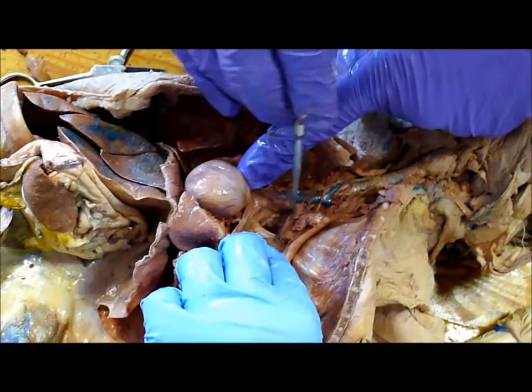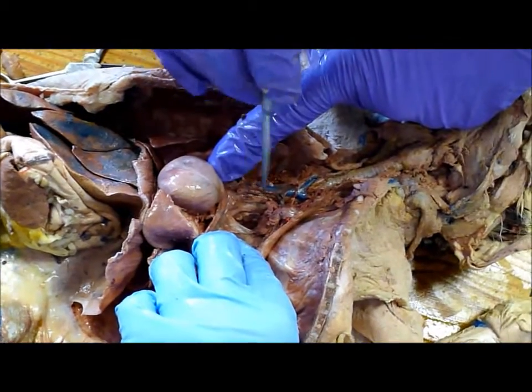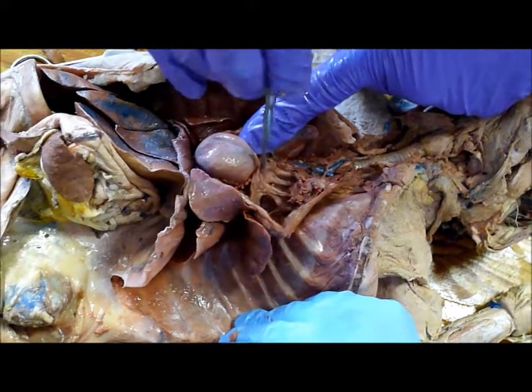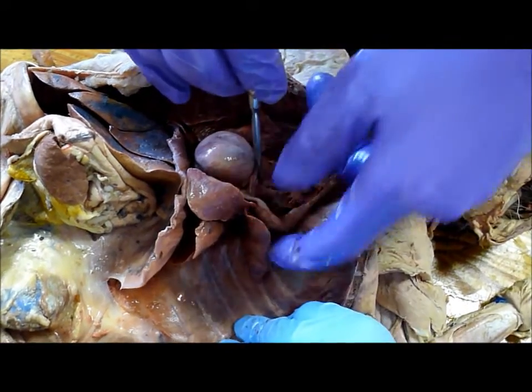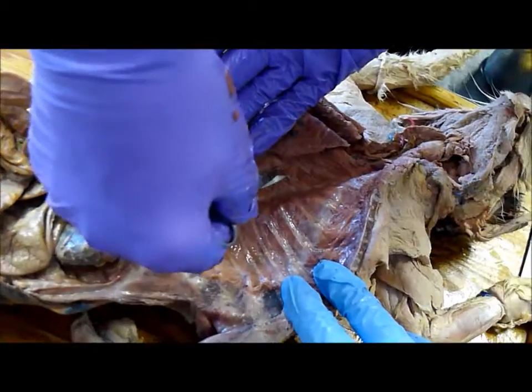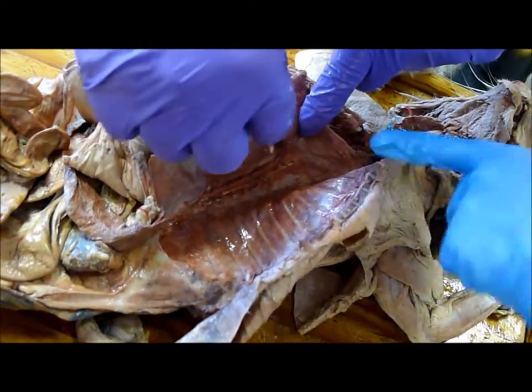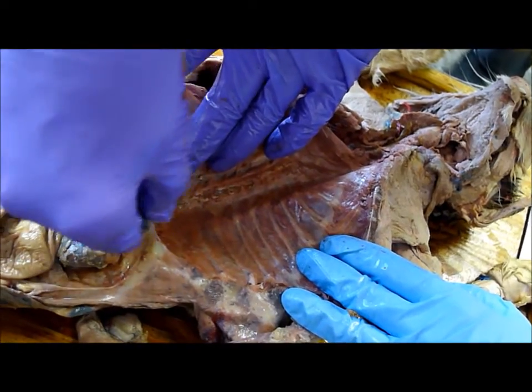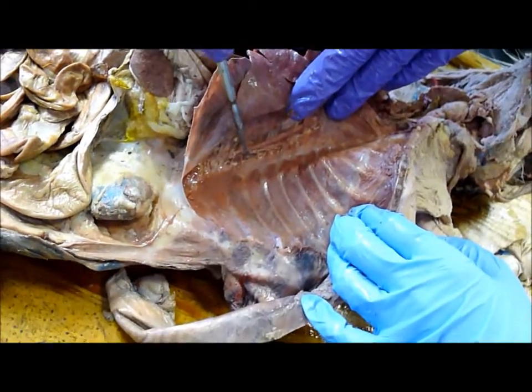There it is — see there's the vessels going up the neck. So there'd be a common carotid artery and a subclavian artery right there. So if you pointed to that one, or the curve, or the down part, that's all aorta on the test — but there are special parts: ascending aorta, aortic arch, thoracic aorta, abdominal aorta. It goes all the way down and becomes the abdominal aorta. See all these little vessels coming out onto the sides? Those are intercostal arteries.